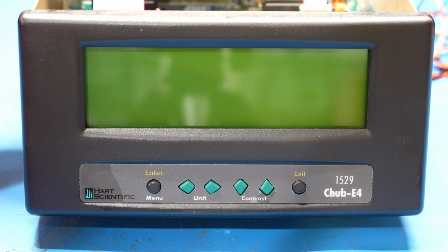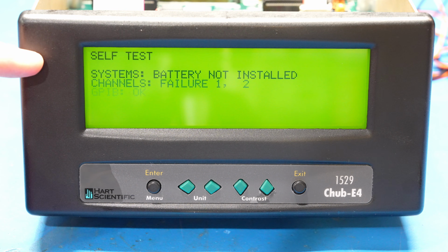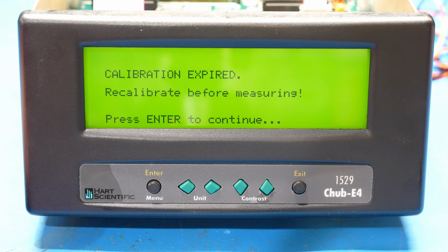So check it out. If I now turn it on, look at that. It does boot up perfectly fine. And then if you look carefully, as it tries to go through the self-test, it says failure 1. That's because I removed one of the modules. And it does tell us that it needs calibration. All of that is okay.